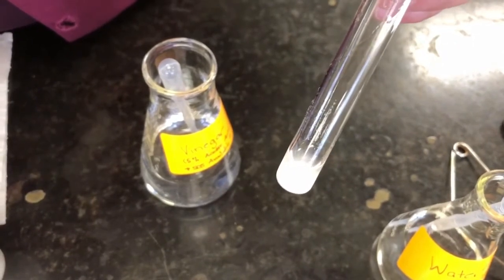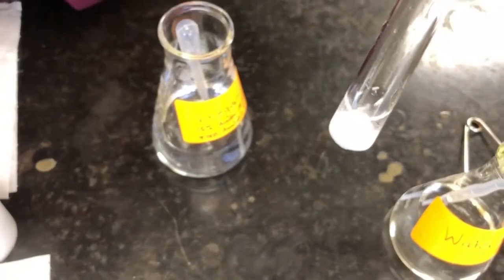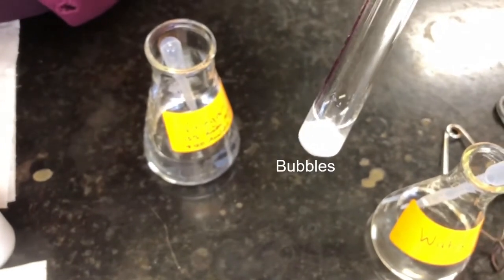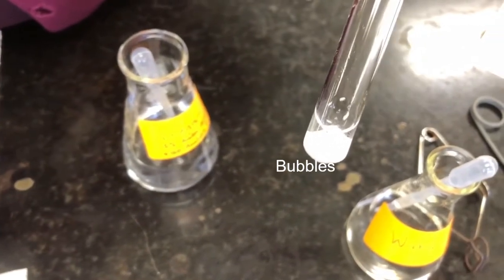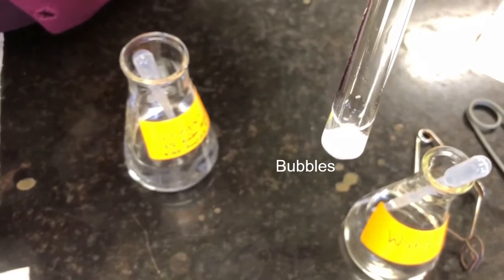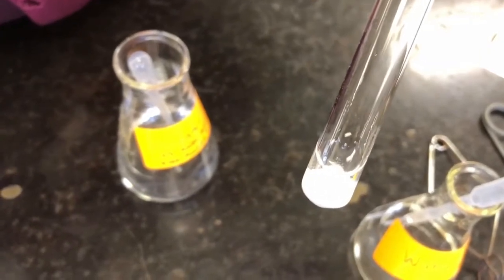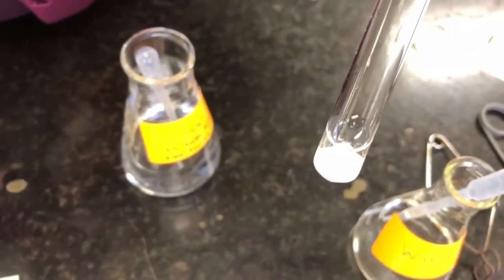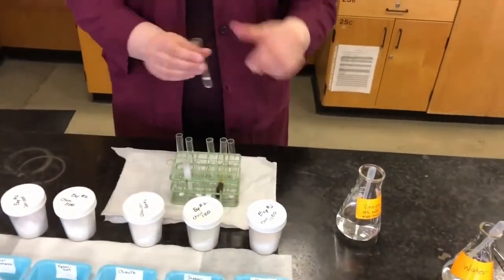Do you see anything happening here? Might be a little hard to see. But you should see some bubbles being formed there where the chalk on the bottom meets the vinegar that I just put in there. Do you see those little bubbles popping up? So that means it's producing a gas. So the effect of adding vinegar to chalk is that it produces a gas, so it bubbles. I remember in our observation and deduction section, we looked at observations, meaning what we actually see. So in this case, we see bubbles. Our deduction is that they reacted to produce a gas. So that's chalk. Now we're going to move on to Epsom salts.